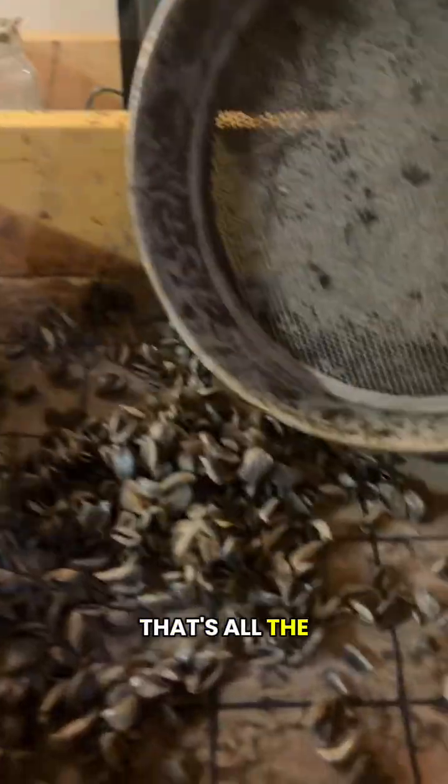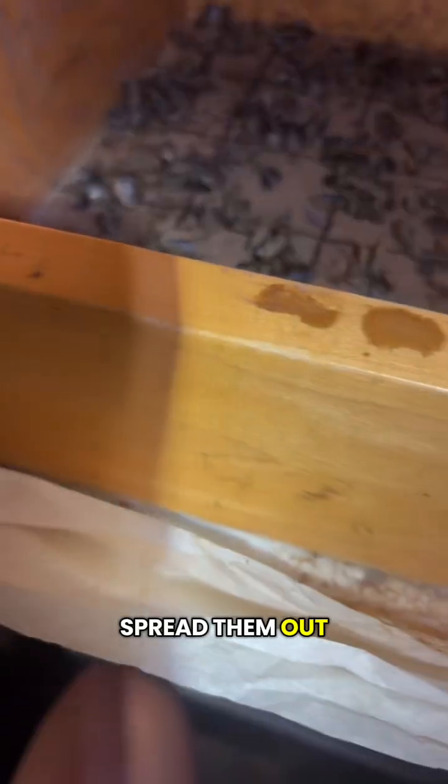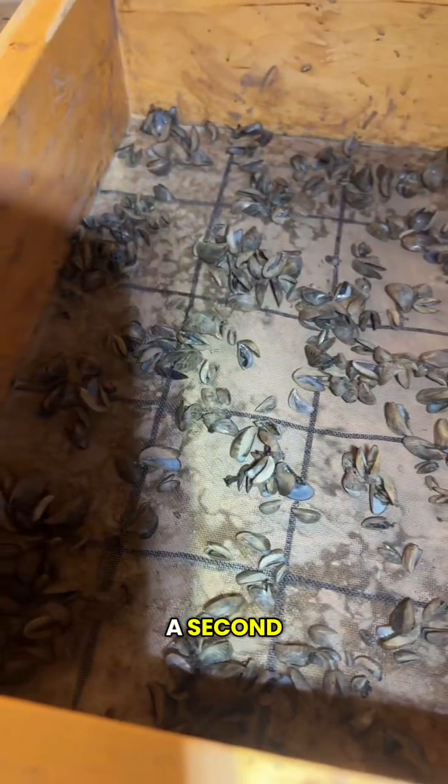I think that's all the, let me turn my light on. There we go. So yeah, that's all the mussels. I'm gonna spread them out. All right, so now they are all roughly spread out evenly, and I'm going to randomly count 200 of them. So I'll see you in just a second.